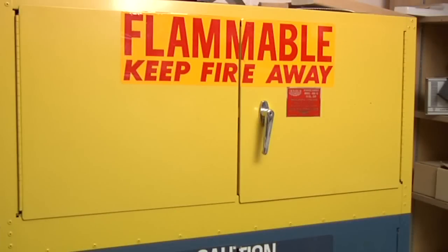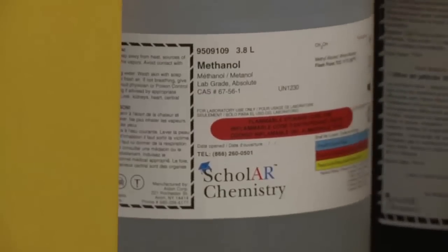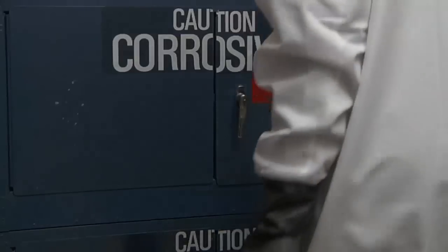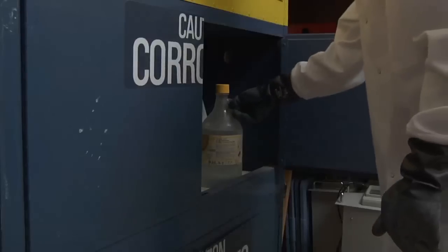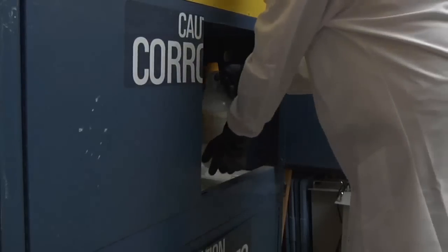While planning a lab, the teacher must consider the toxicity and flammability of all reagents and the products they form. Methanol is the most toxic and flammable substance employed in this lab. Acids need to be stored in a location separate from flammable alcohols, in a cabinet specifically designed for acid storage.